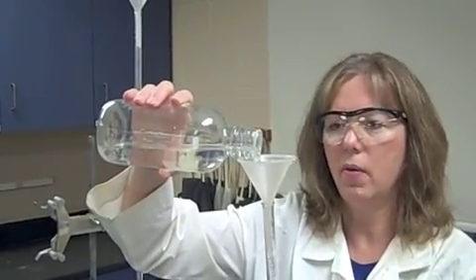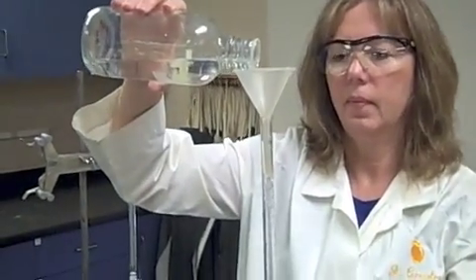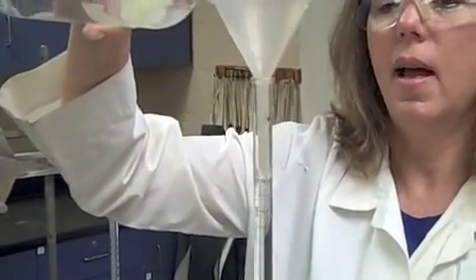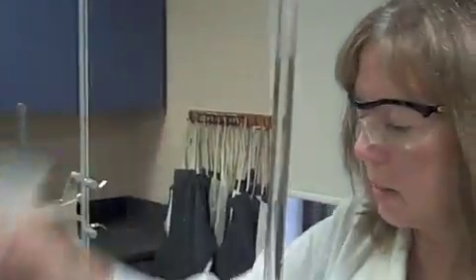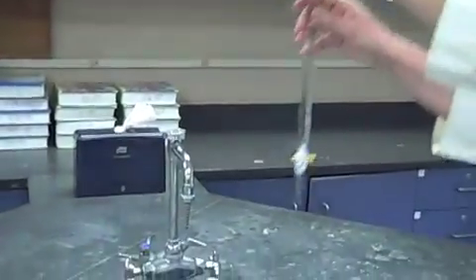Carefully watch so you don't go over. That would not be good. I'm adding the acid until I almost get to that top line. It's okay if I went a little over because I'm going to have to let it out of the stopcock anyway. And I'm going to let that acid out into the sink.